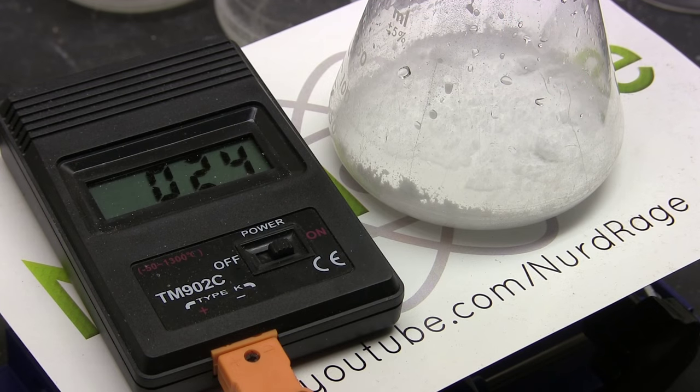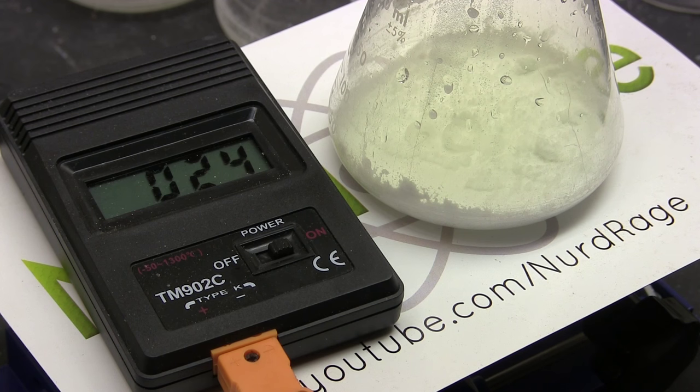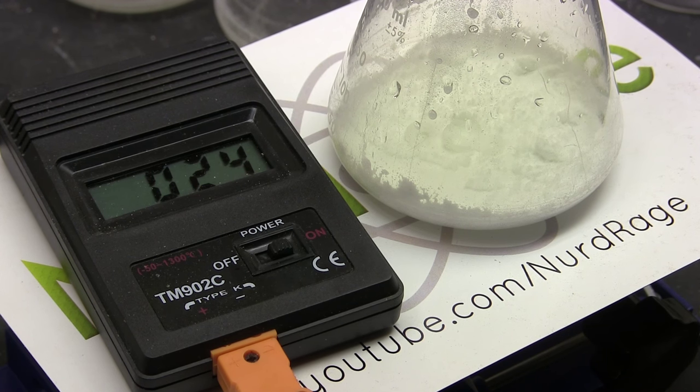A lot of that should be the propionic acid azeotrope. You're probably wondering what that white powder in the receiver is. That's sodium bicarbonate. As the distillation starts what comes off first is the dissolved chlorine and chlorine dioxide. The alkaline sodium bicarbonate helps to absorb the gases so there is less emitted into my gas scrubbers and ultimately into my fume hood. You can also use sodium hydroxide or other caustic chemicals. Scrubbing the gas like this is optional if you don't mind releasing it into the environment.